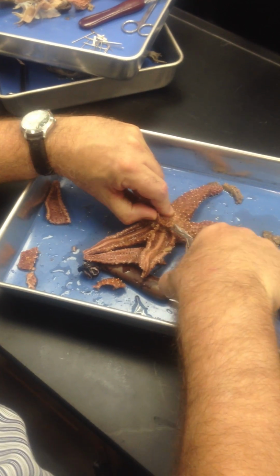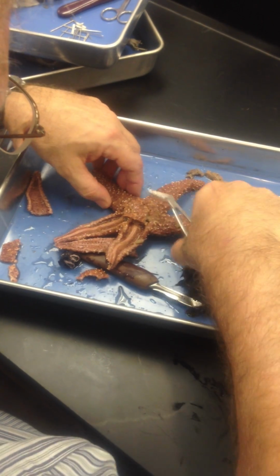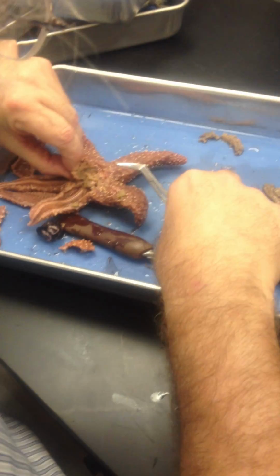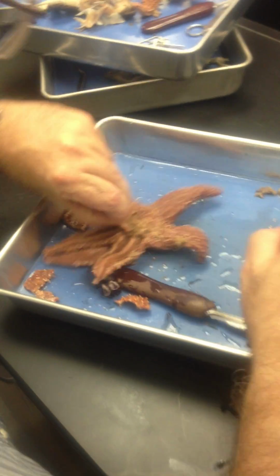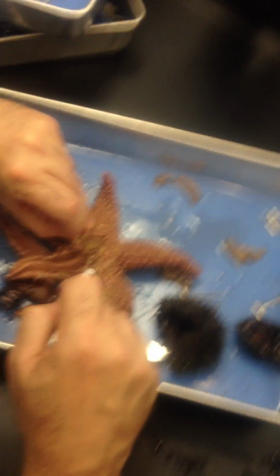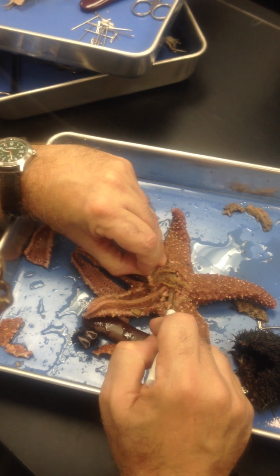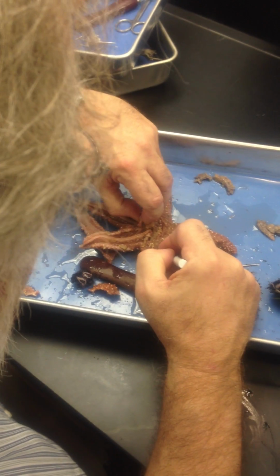I can cut this as long as I'm careful not to sever too much, which is easy to do. Wait a minute, let's see. Beautiful. That, right here, you see me teasing it? That, how sweet it is, right there. That is the stomach. Do you see it? Sometimes called a pyloric stomach. And let's see if I can actually find the stone canal associated with that.